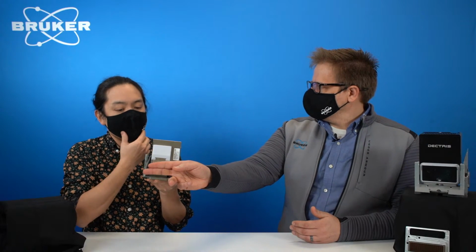So for the LynxEye, let's see if I can do this without knocking it off the table, right? The LynxEye has strips that are oriented top to bottom like this. Okay. So one way that you could look at 2D in a traditional gamma 2D mode would be to rotate it, which is why we have this box here on the detector. It's very easy to rotate it 90 degrees, and then your strips are now pointed this way. So you actually have resolution in the gamma direction, right? And then you would just put a slit in front of it to get the 2 theta and scan to build it up. Exactly. So then your detector would be moving this way, right?